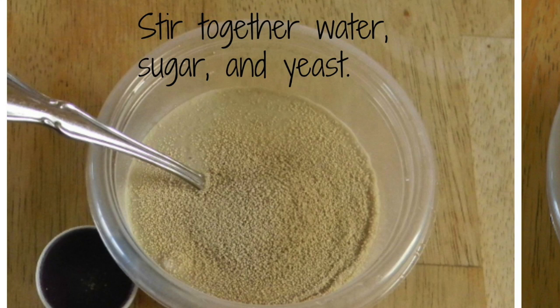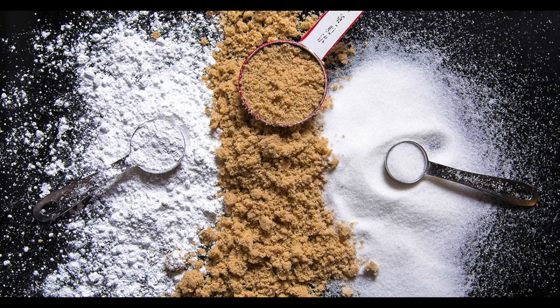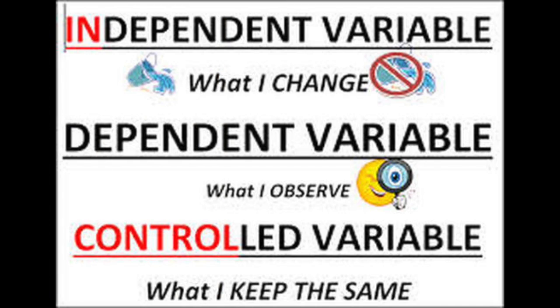In this experiment, we first measured out 10 milliliters of water, 0.25 grams of sugar, and 0.5 grams of yeast. We did this 2 times for each type of sugar that was being tested: brown, powdered, and the control, white sugar. We kept these weights the same across all trials. The independent variable was the type of sugar used, and the dependent was how much CO2 was produced.